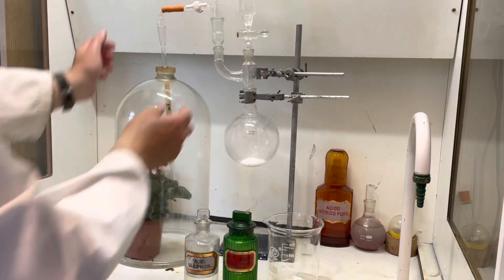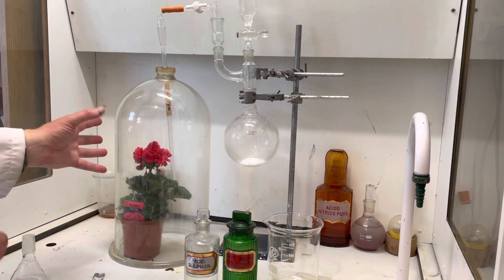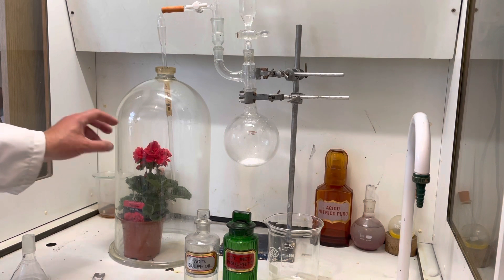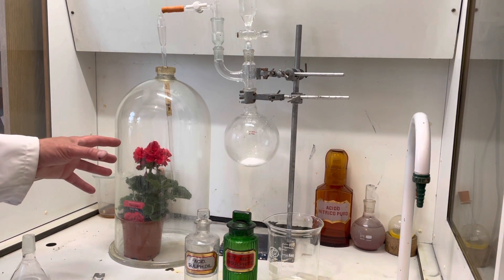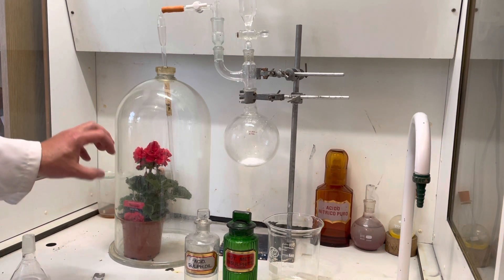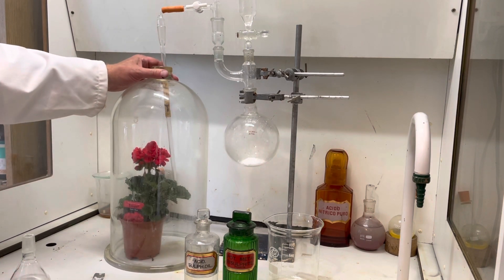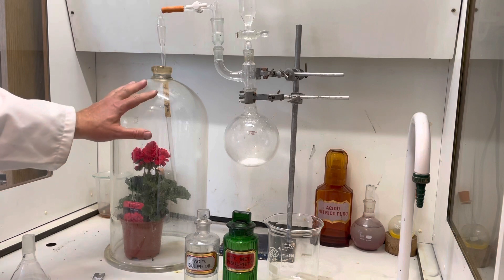Sulfur dioxide has the property of being able to reduce coloring agents. Over time, the color in this geranium will begin to fade, and the whole plant will begin to die simply because of the acidic conditions of the sulfur dioxide around it. Instead of breathing in carbon dioxide, the plant will be breathing in noxious, choking sulfur dioxide, disrupting lots of the enzyme processes in respiration. The results in about 10 minutes will be quite dramatic.